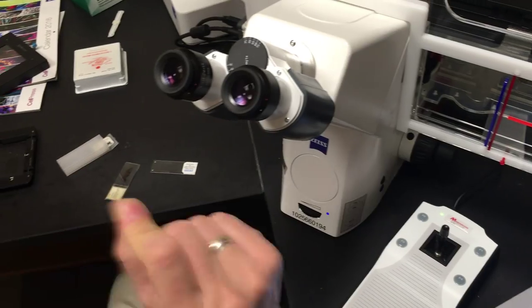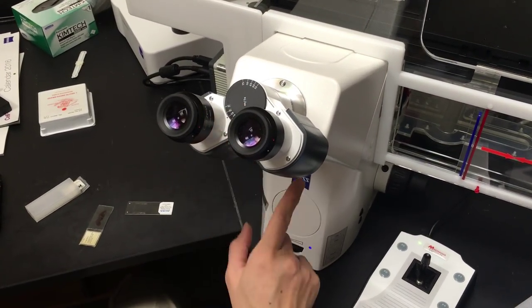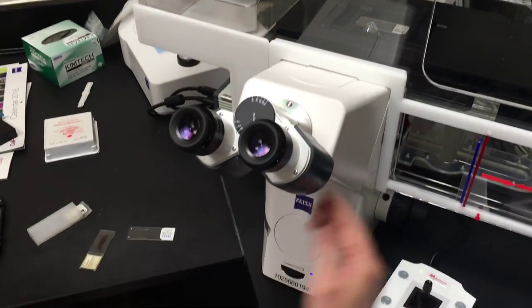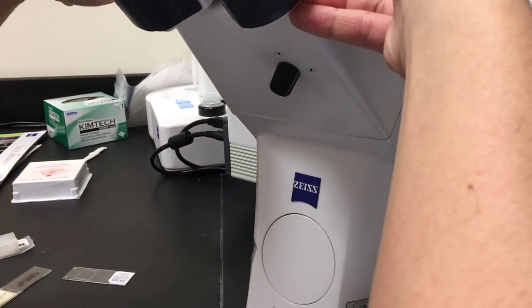One other thing—a little thing but sometimes it can cause problems—is this binocular tube has a shutter. If it's in this position, it actually shutters the binocular tube so there's no ambient light coming through.